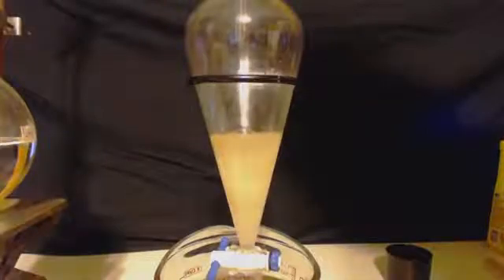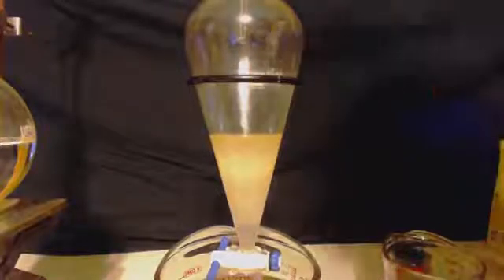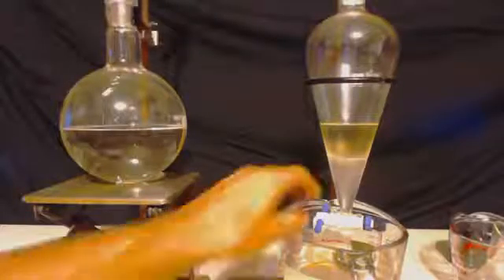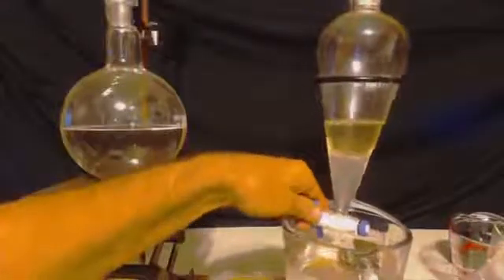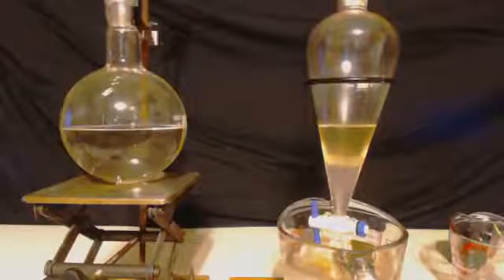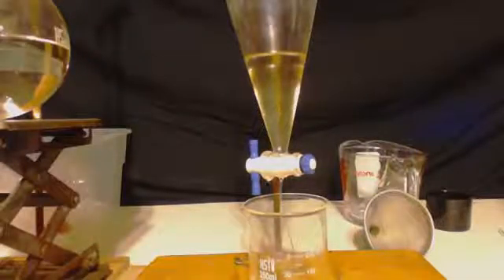Now, as you saw, I was washing those hydrocarbons with water, so I put traces of water in there. So, what I'm going to do is I just threw some salt water in. That's even more polar than water, and it'll extract a lot of that water out of the toluene that trace amounts. Still going to be a little bit in there, but get a little bit out of there, drain that out, and then we're going to put it in something so I can see how many milliliters there are. There's still going to be a little bit of water in there, so I'm going to throw some anhydrous magnesium sulfate in there, which is epsom salt that I dried out, and what I got was 75 milliliters.